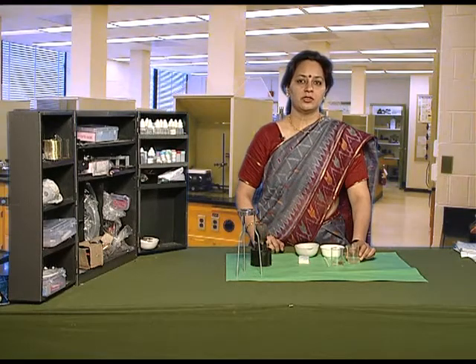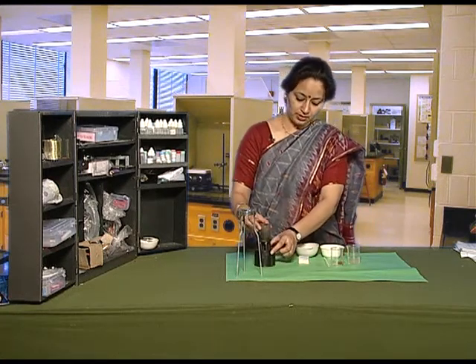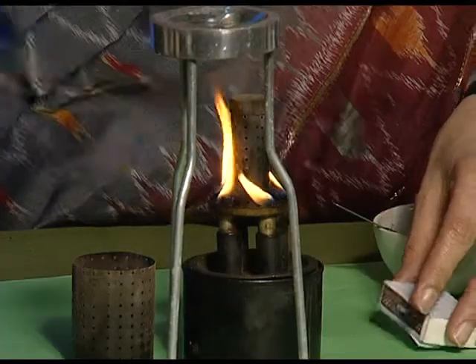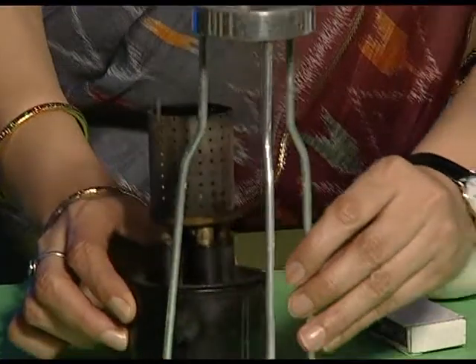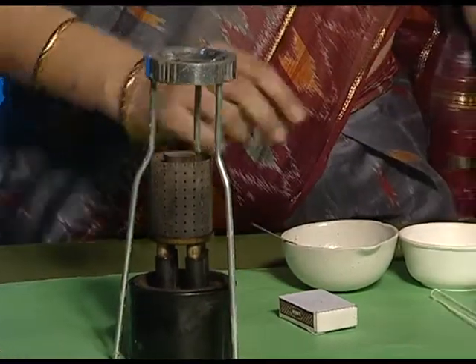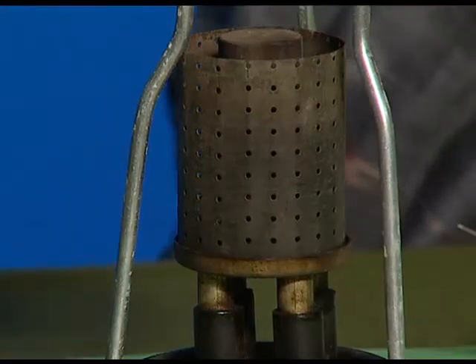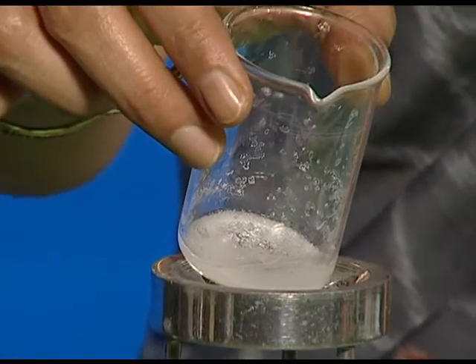To separate salt from the salt solution, we will do evaporation. For this, we will first light up the kerosene burner. Place it below the tripod stand and keep the beaker containing the salt solution on the tripod stand for heating. As the solution gets heated up, we will see that water starts evaporating. After the entire water has evaporated, we will see that the solid component, which is the salt, is left behind.